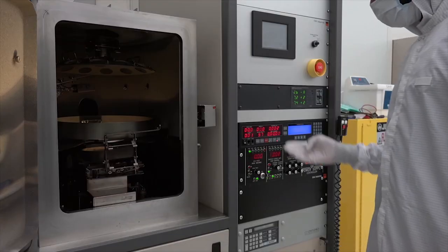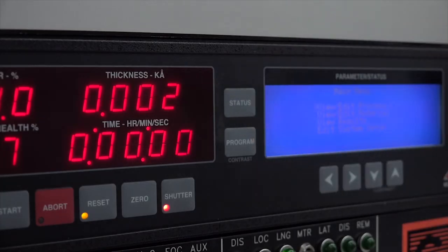Like many thin-film deposition instruments, this evaporator uses a thickness monitor, which is here. So, we can monitor the film thickness that is being deposited.